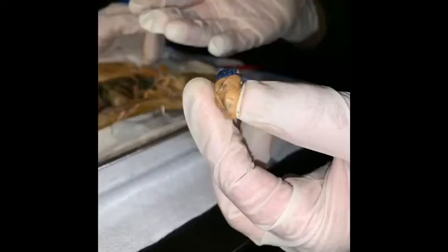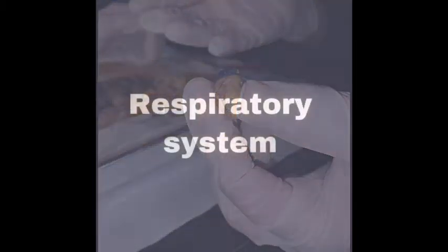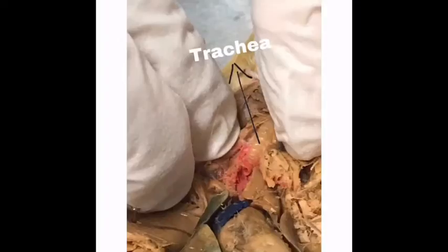Now, when compared to humans, the rat heart is obviously smaller. However, they both have 4 chambers, the structure is basically the same, and they both pump blood in the same direction. After cutting through the thoracic cavity, we located the trachea, which is a tube that extends from the neck to the chest.